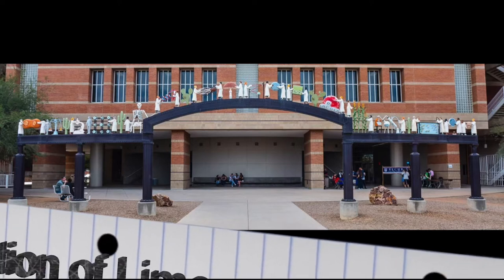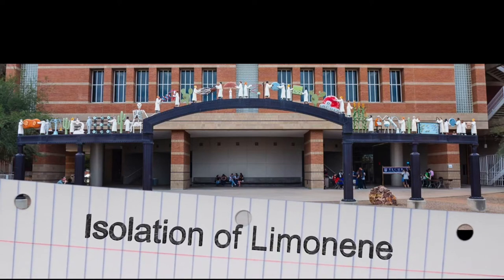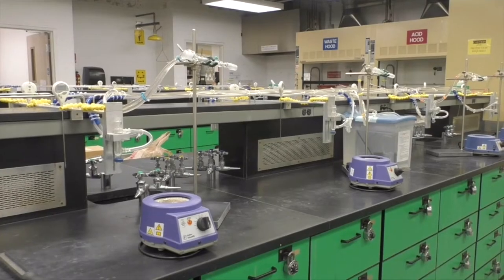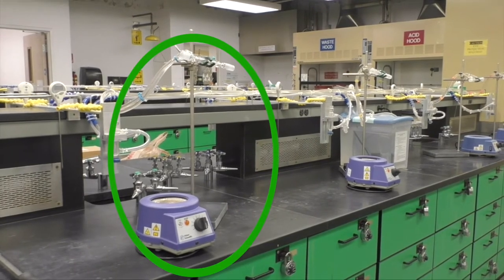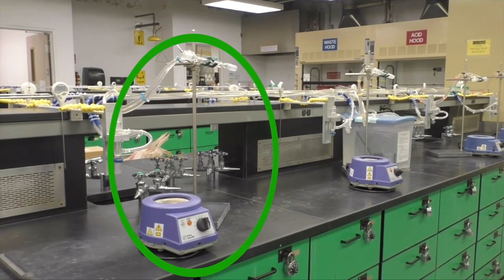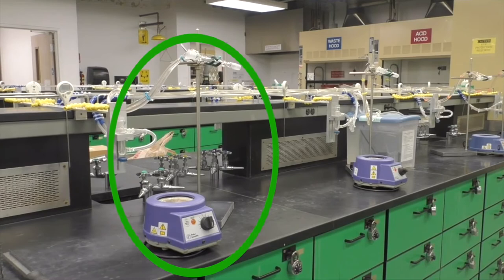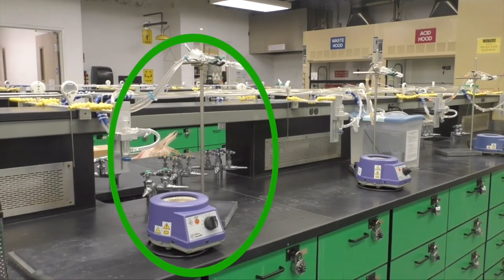This video will show you how to properly set up a standard distillation apparatus to isolate limonene from orange zest. For this experiment, you will be using a macro distillation setup. Please do not move the preset equipment or remove any pieces from it.